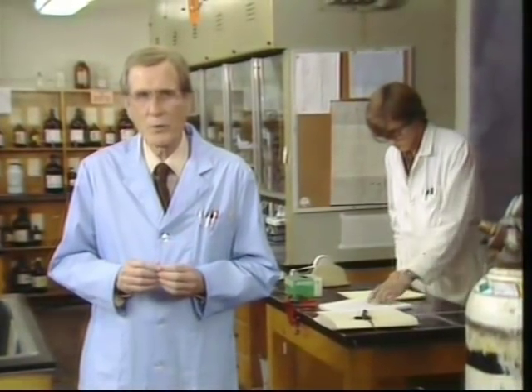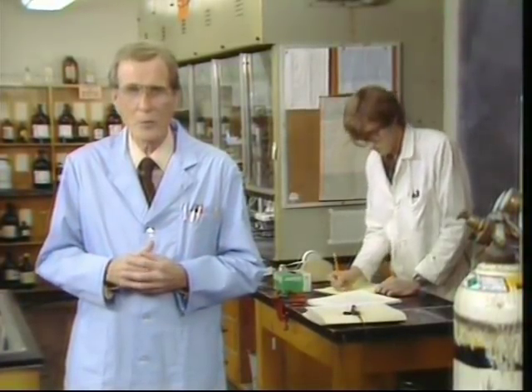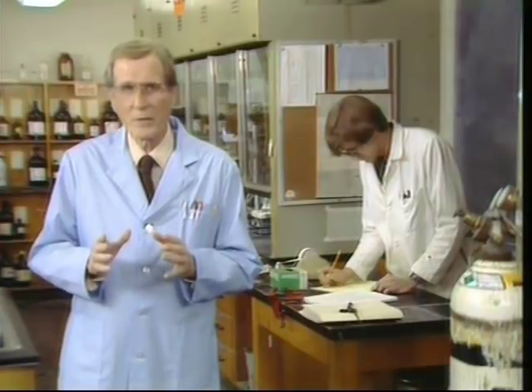And since we're unable to discuss items unique to your specific lab, your lab instructor will inform you of any rules or procedures that are particular to your lab. For the same reason, information about specific experiments must be obtained from your lab instructor and your written lab instructions. However, we will discuss general safety methods and procedures that you should follow at all times in any laboratory.